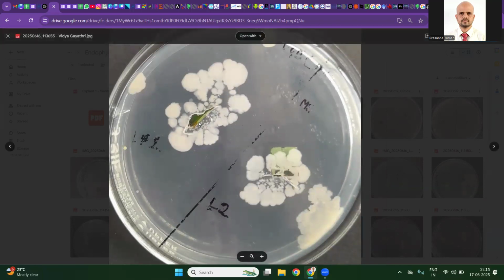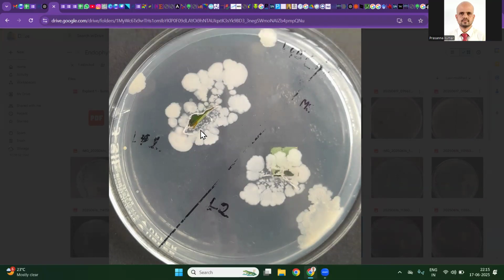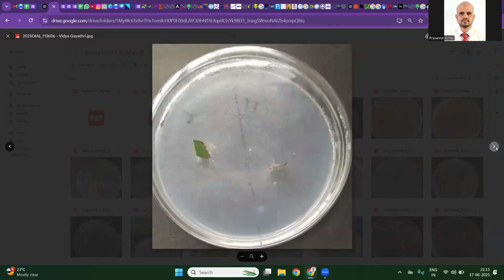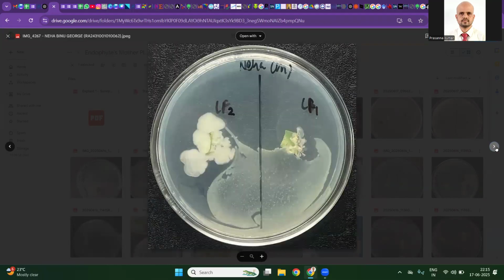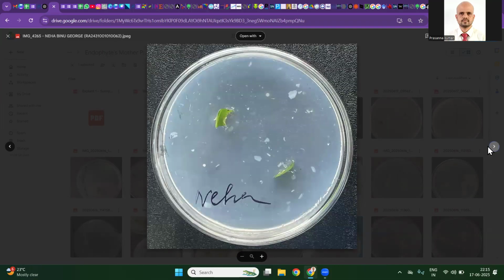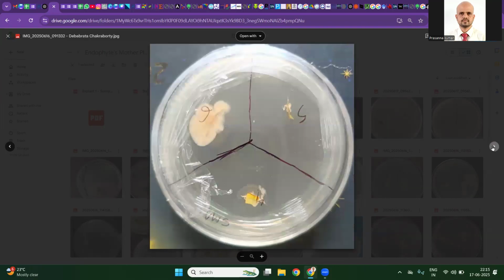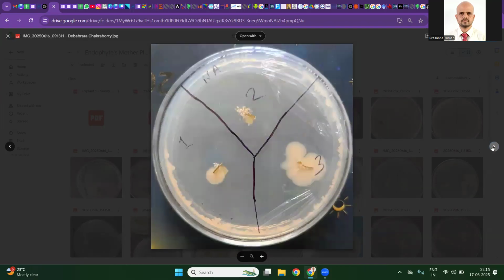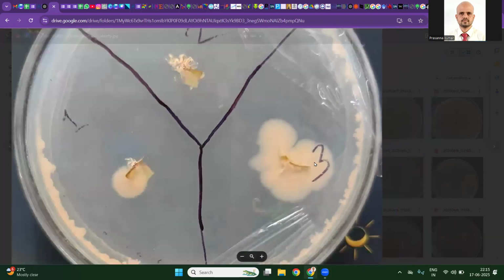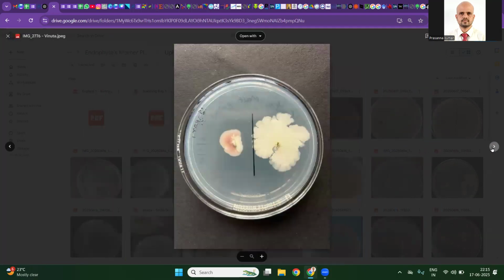Still, these are questionable, but whatever you have around the explant, maybe here the water is still there. The excess distilled water from the last wash is actually carried into the plate, I guess. Take a little more care over this. This could be an endophyte if there is no growth in the imprint plate. All are good results. If the imprint and laminar control are clean, this is definitely an endophyte. We have to go for further subculturing.